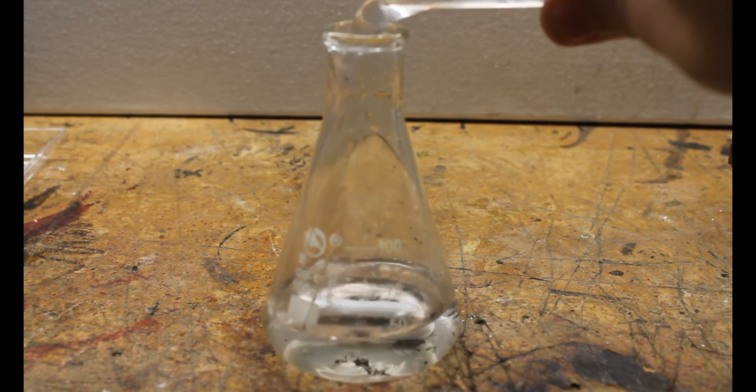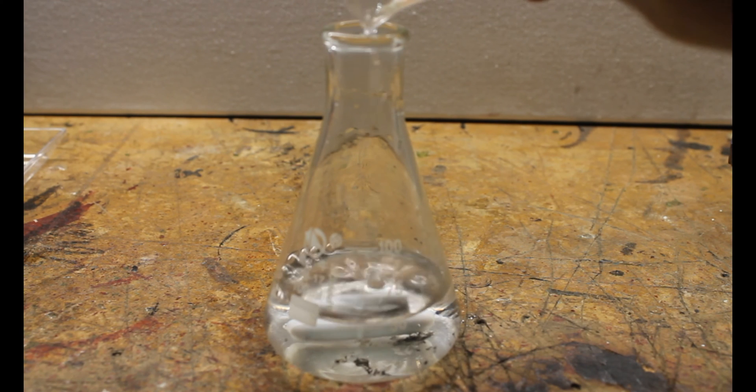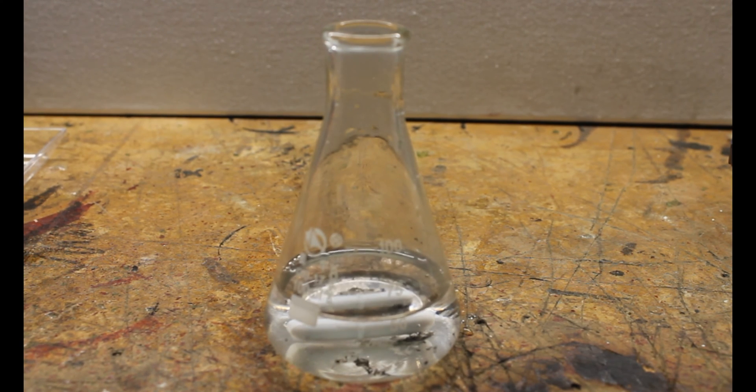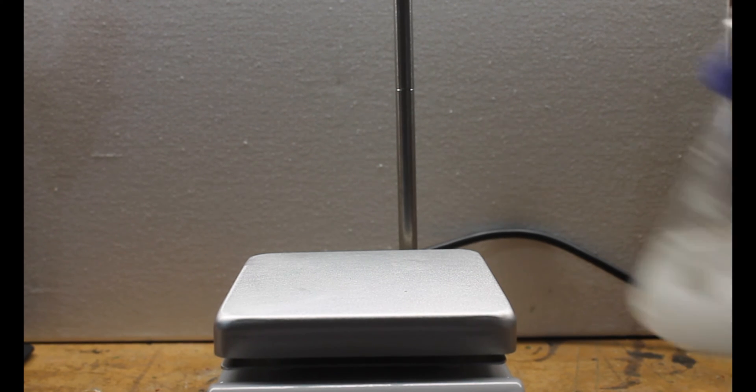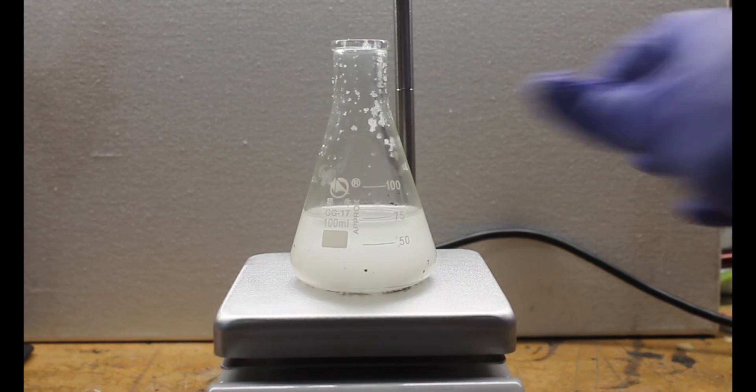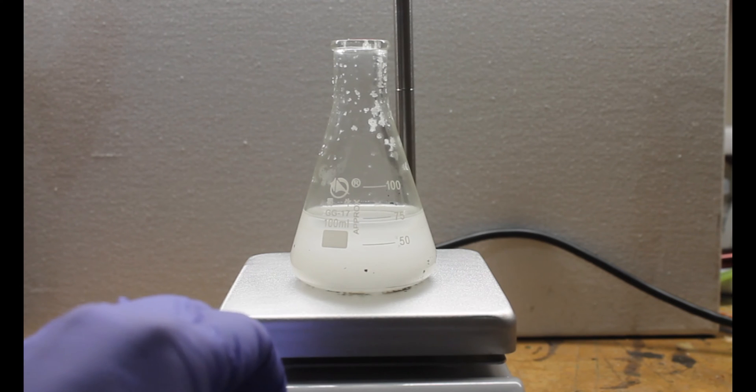For this reaction we need a very concentrated solution of sodium hydroxide. So we'll be using 54 milliliters of water and 40 grams of our crystalline sodium hydroxide.